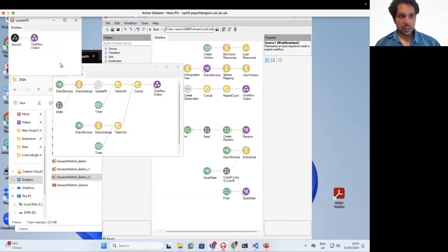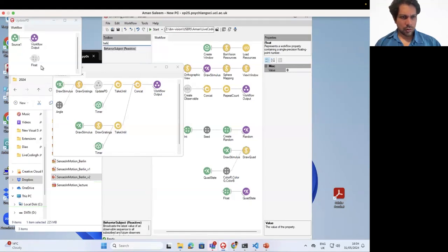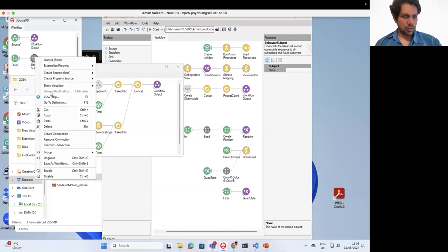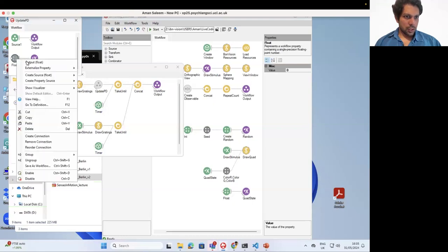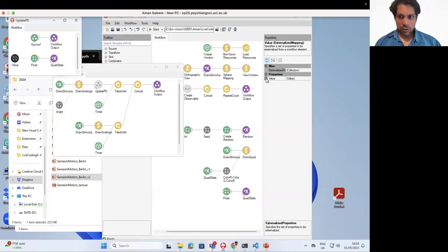And then inside update photodiode, basically, I just want to say, I can just do a float, and I'll say, it should be a behavior subject or replay subject. I think it should be a multicast subject. And this is going to be quad state. And then I externalize this property. I'm going to call it PD state.